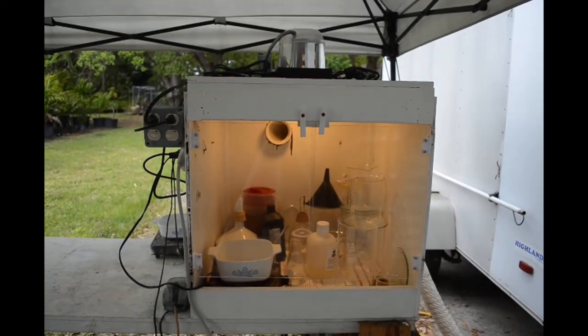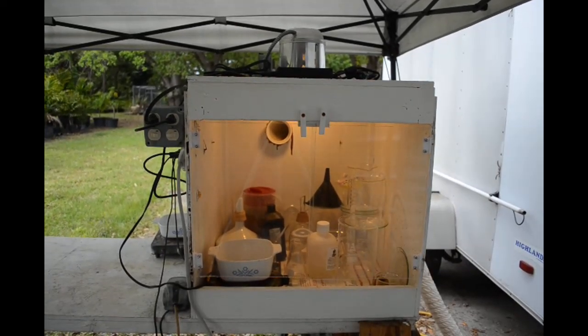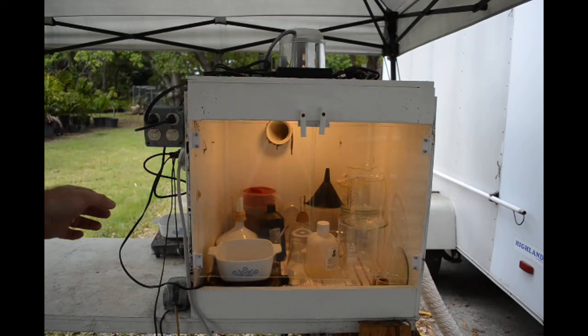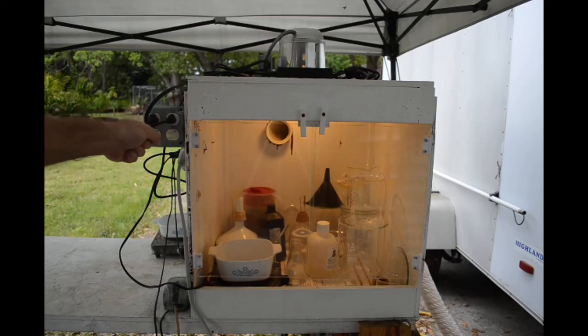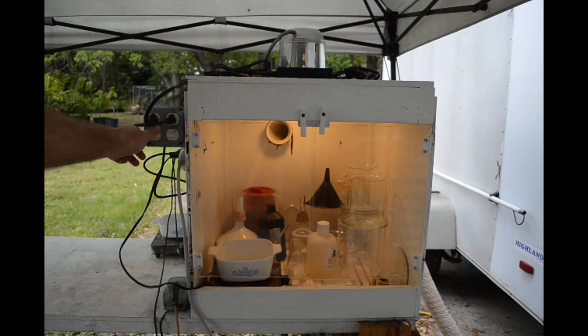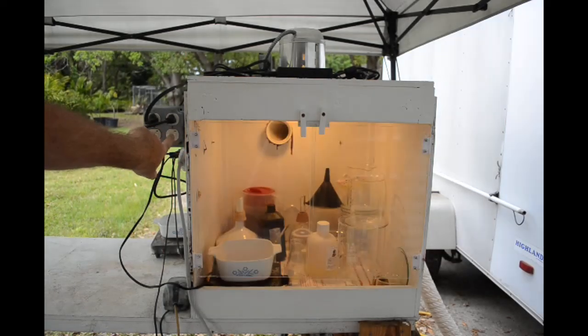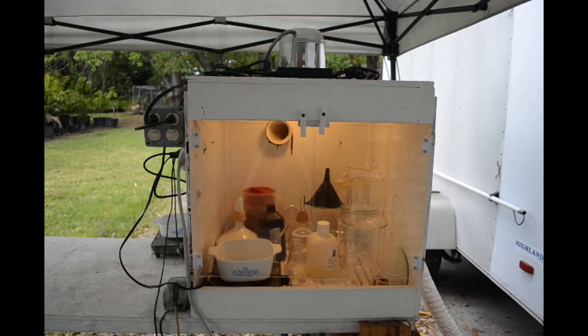I've got lighting again so that's a beautiful thing. Up until recently I was always having to plug in and unplug the blower and the light. So now I've got a little panel here that I can just turn them on and off easy enough. That's the blower and that's the light.